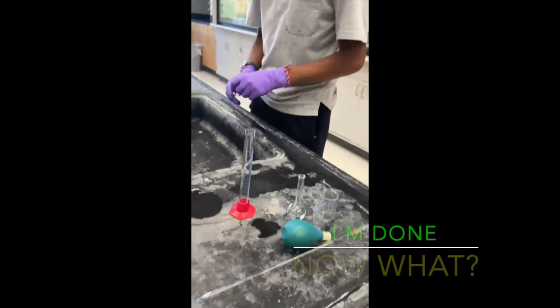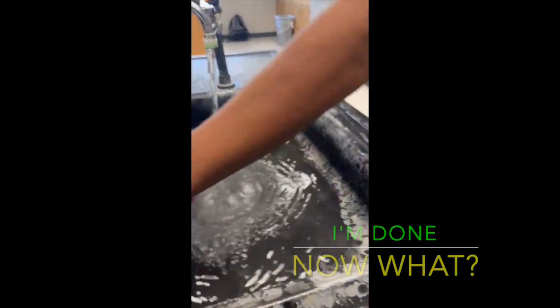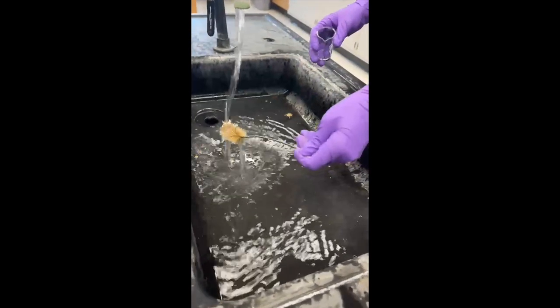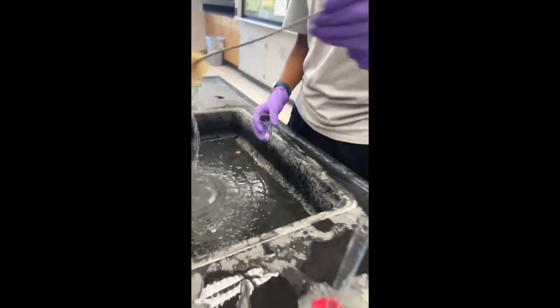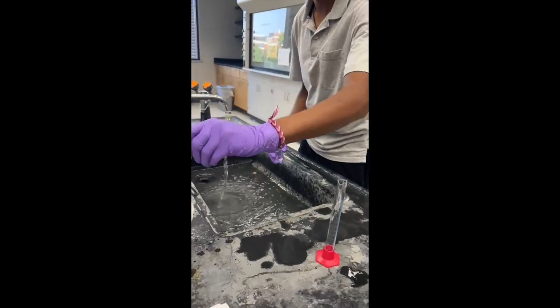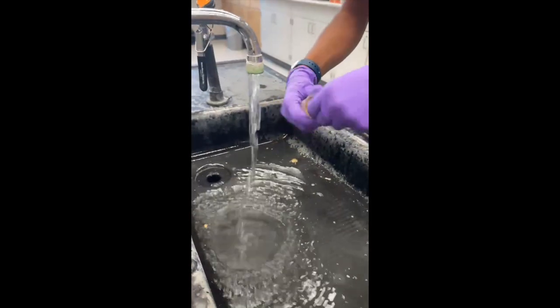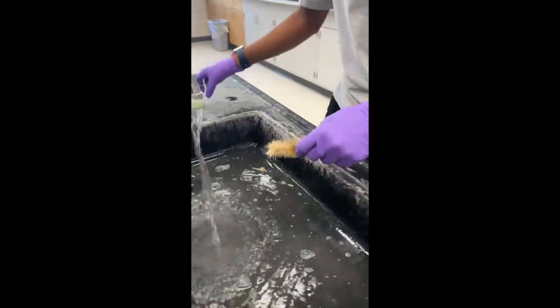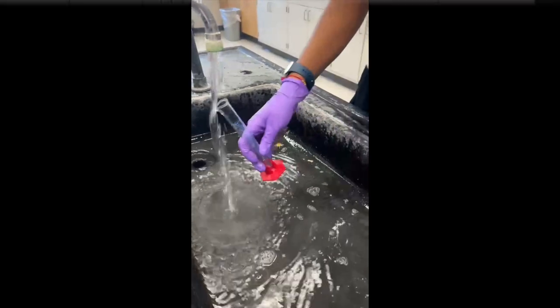Once your dilution is complete, it is important to clean your lab space properly. Make sure you dispose of any waste properly and make sure you keep your lab area clean. That's how you're cleaning up those things.